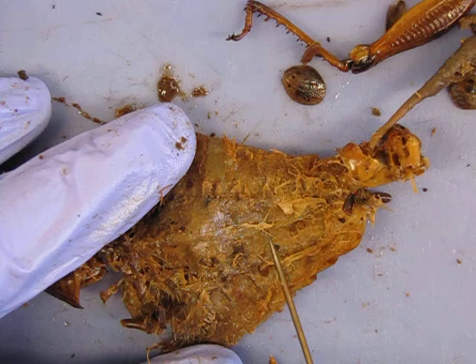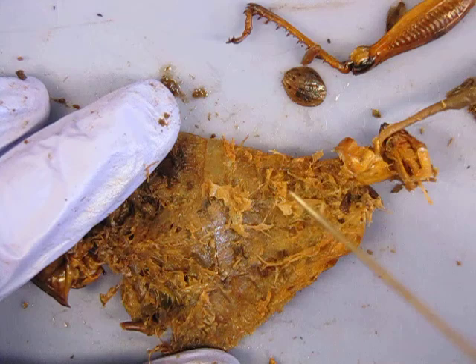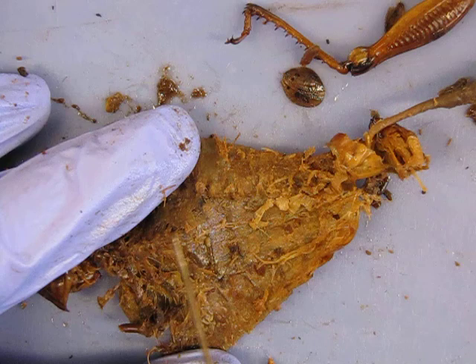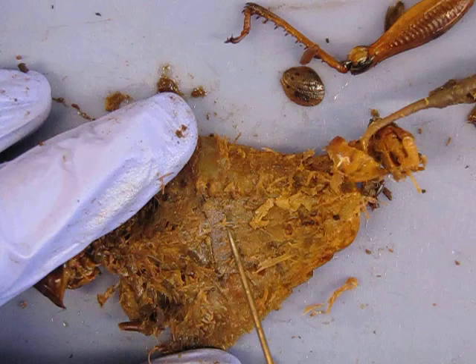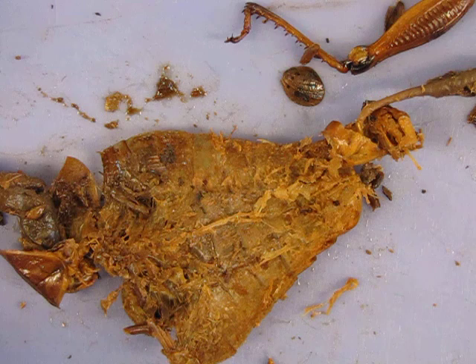There's the nerve cord. They have a very small — what you would call a brain — up in the head, the cranial region. I'm just carefully teasing away what I can to try to expose more nerve cord, and I can sort of trace it along there. That should be most of what you need to know. There are other structures you have to know, so make sure and look at the PowerPoints and the sketches, and for anything you can't find or any questions, always ask me.